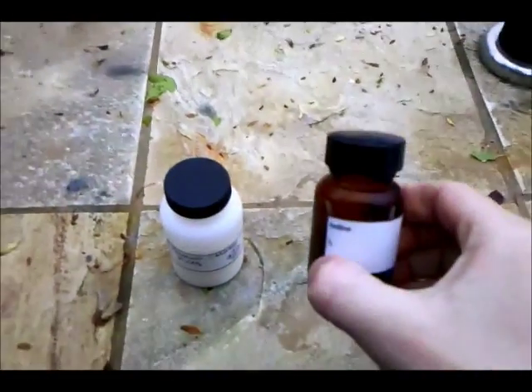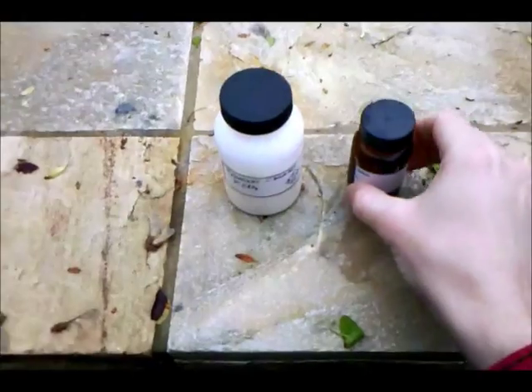So what you'll need is potassium chlorate and iodine.